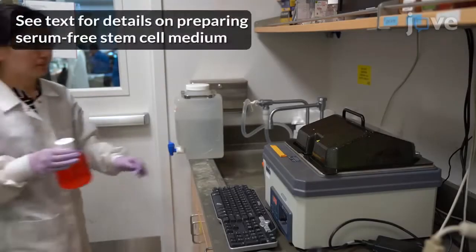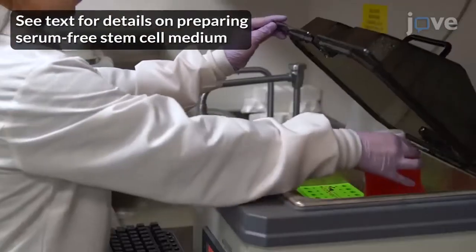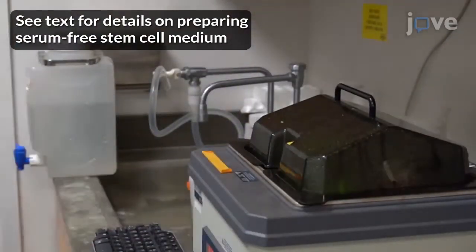To begin this procedure, warm up the serum-free stem cell medium by placing it into a water bath at 37 degrees Celsius for 20 minutes.